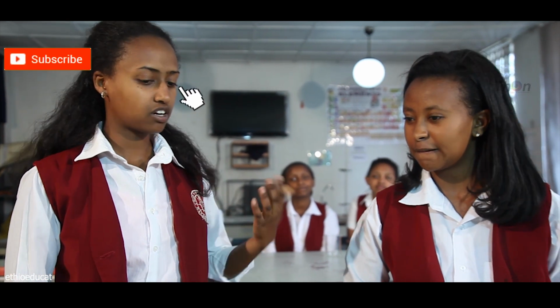Okay. Hello, Liu. Hello, Rodit. What are we going to do today? Doctor has already explained the materials that we are going to use for our experiment, but to remind and to be specific, what do we have here?